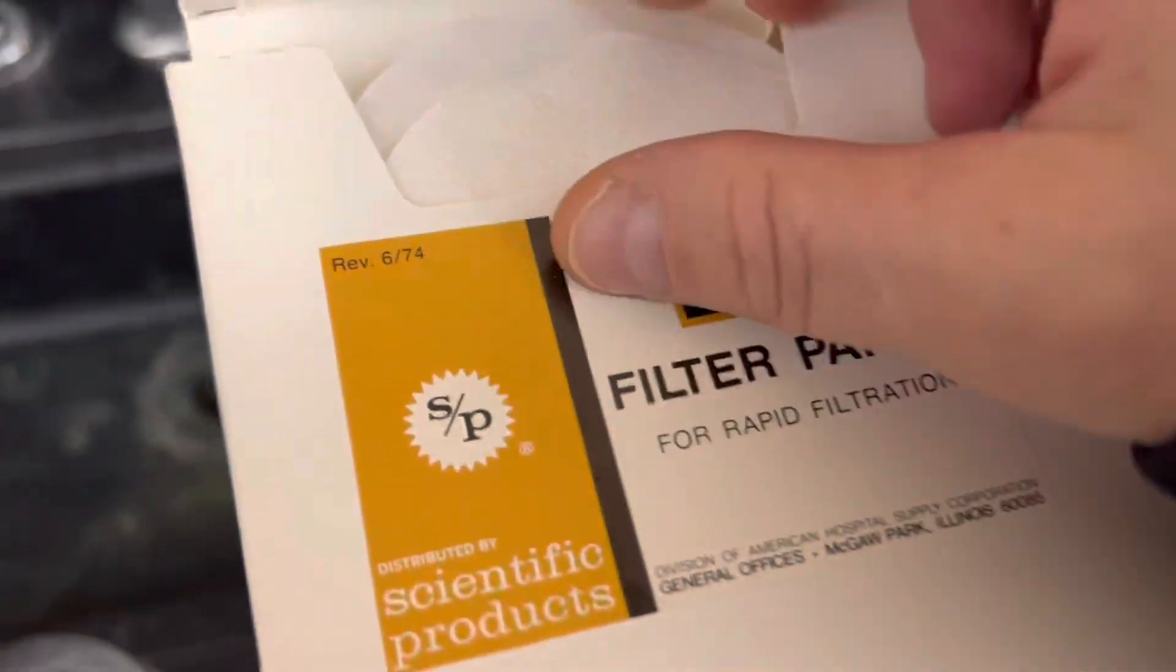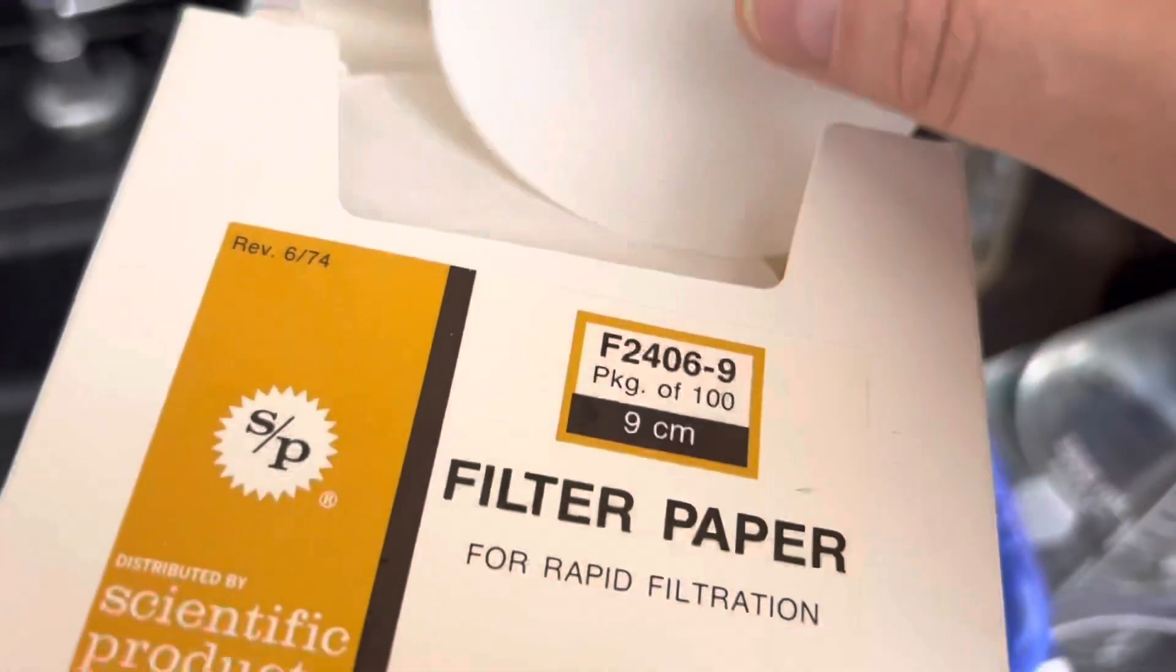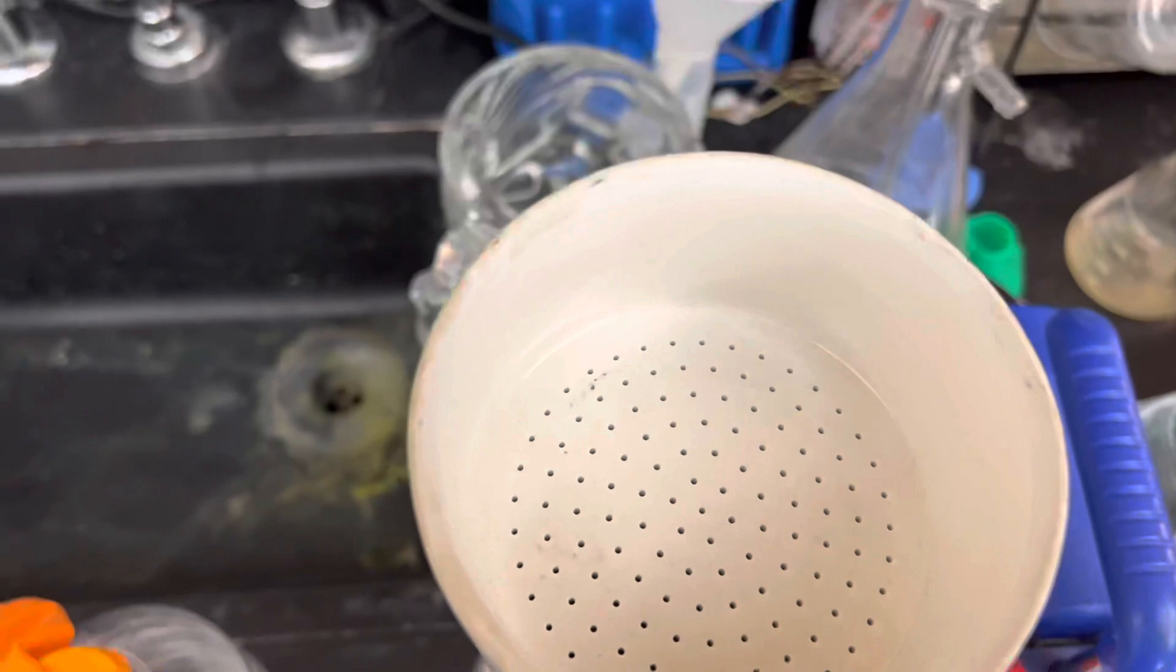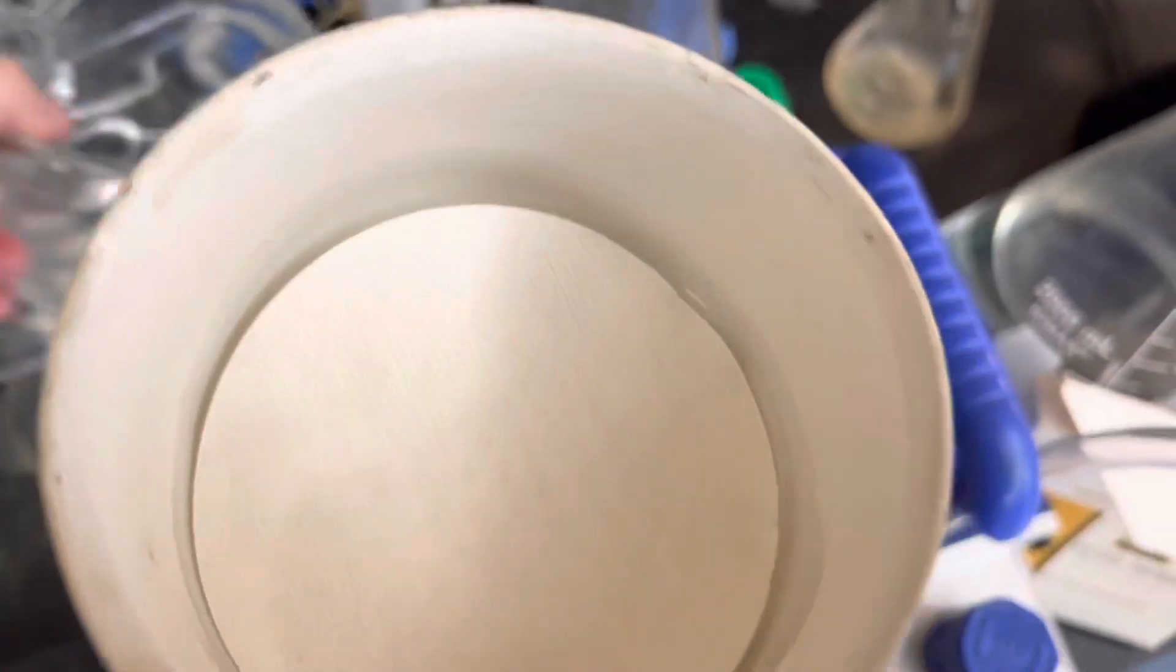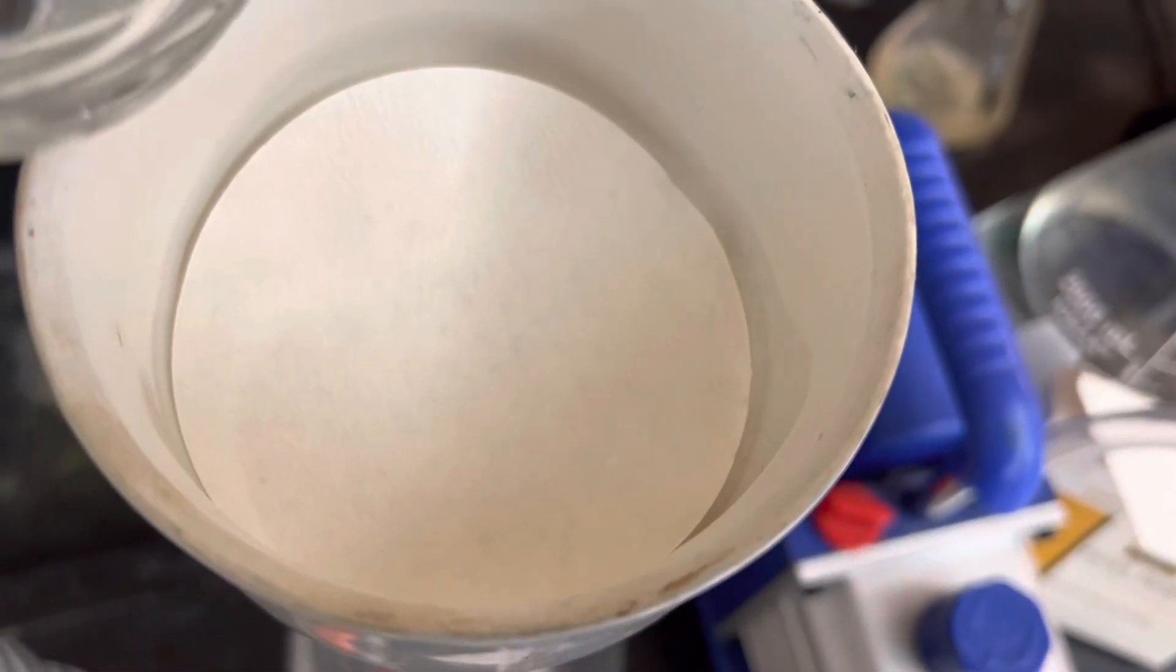I'm ready to use some filter paper for my vacuum pump and I'm going to put that here. And I like to add a little bit of water just to get a good seal.